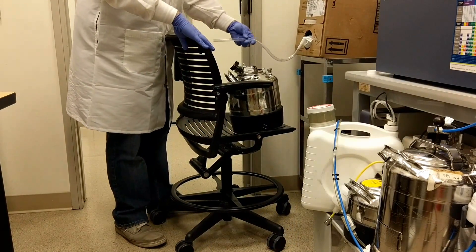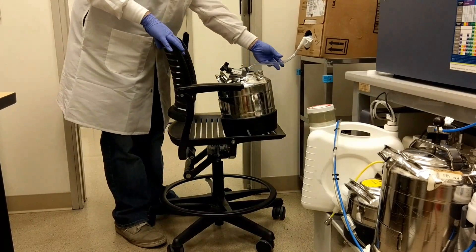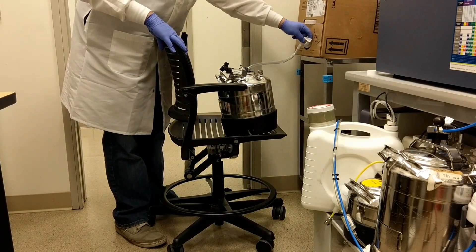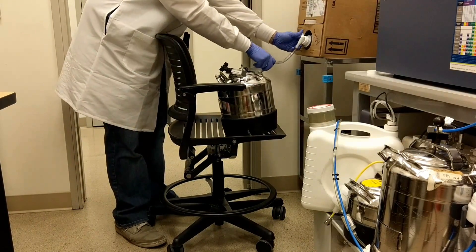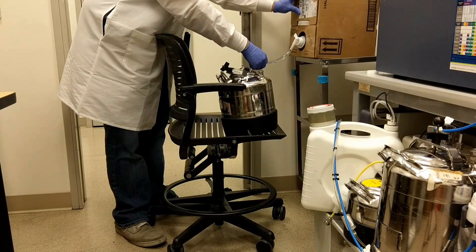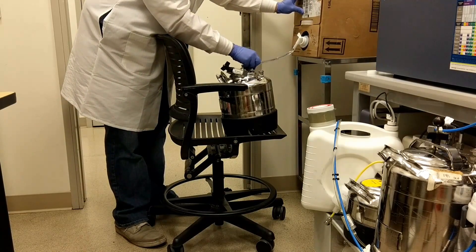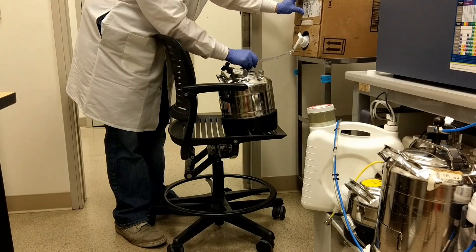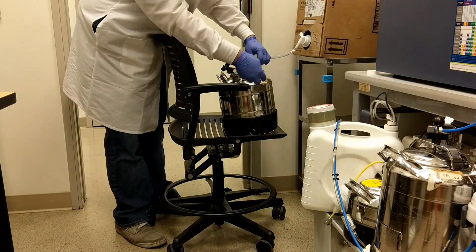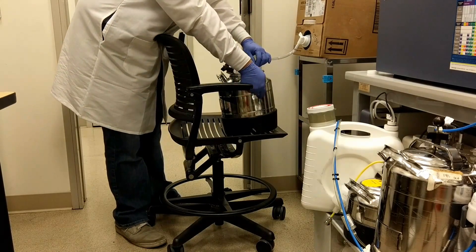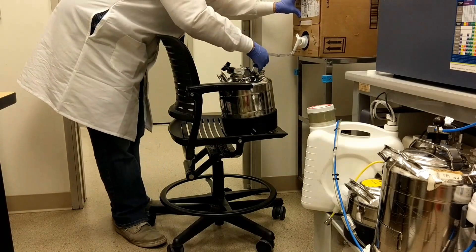We keep this hose on it, so you just put this tubing into the sheath tank, open the valve, and you'll see the fluid flow. This box is almost empty, but you'll want to fill it to the weld mark right here on the tank. So you don't want to overfill it, just fill it to that weld mark.